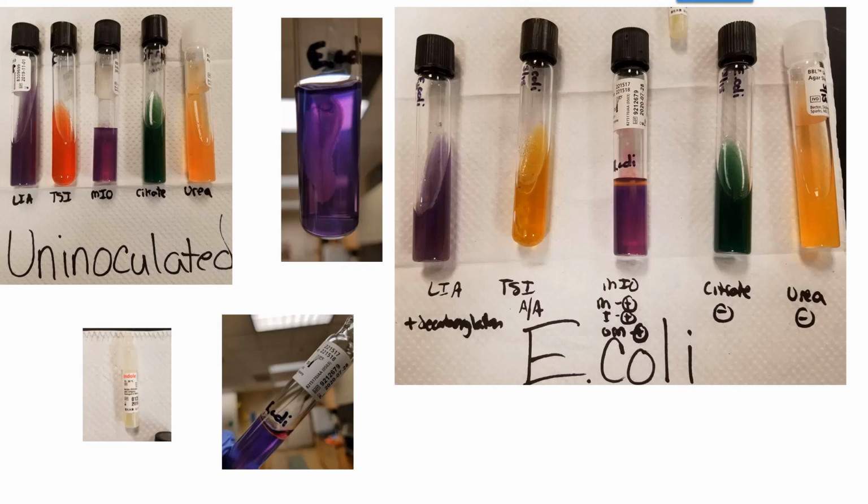For the E. coli, it is positive for motility. I zoomed in on it. We had a stab mark, but you can really see all that cloudiness around the stab mark. It is positive for ornithine breakdown because it's got a purple butt, and it's positive for indole production. We would add indole reagent to the tube, and there's that hot pink indole fluid on the top there. Citrate is negative, we don't see any blue, and urea is negative, we don't see any hot pink whatsoever. This is just to show what the original colors looked like.